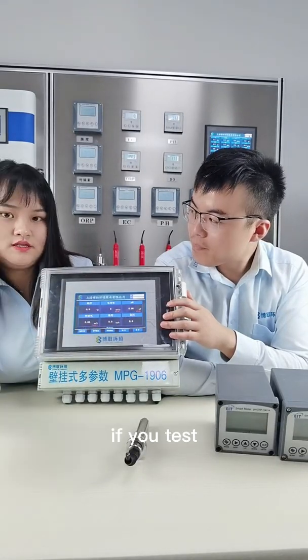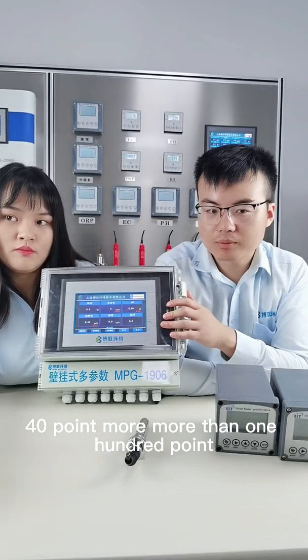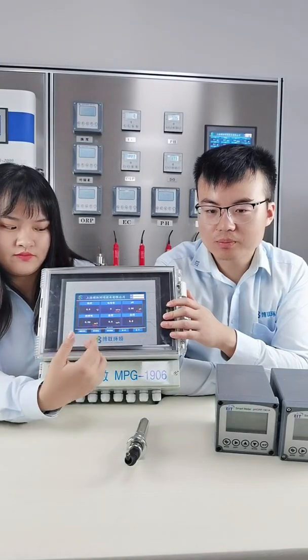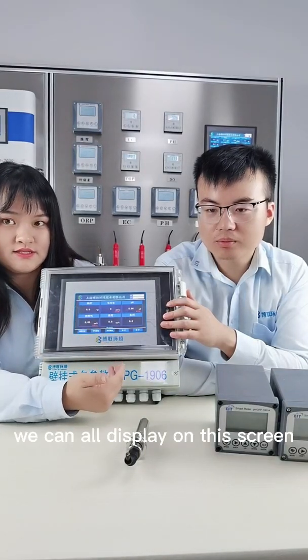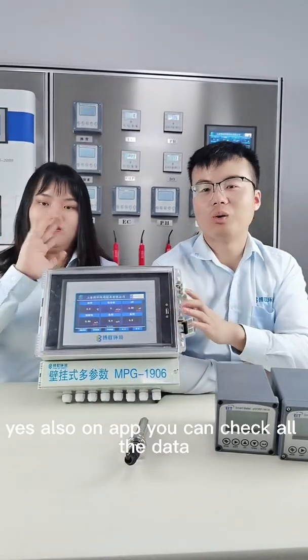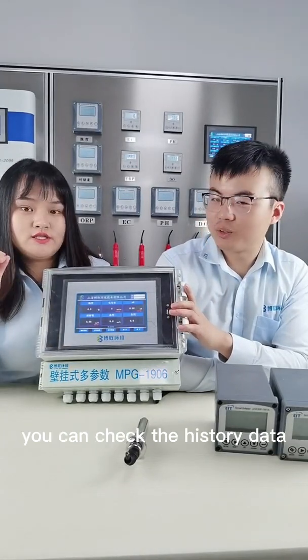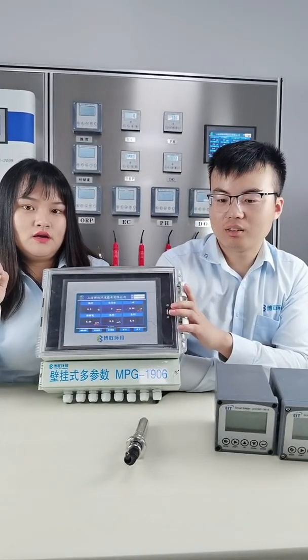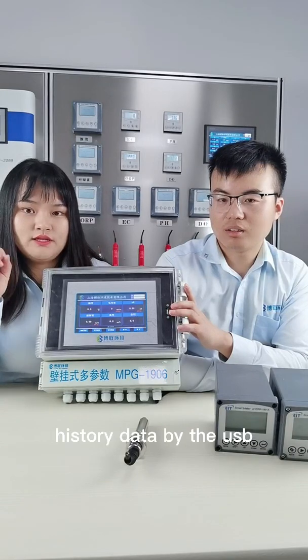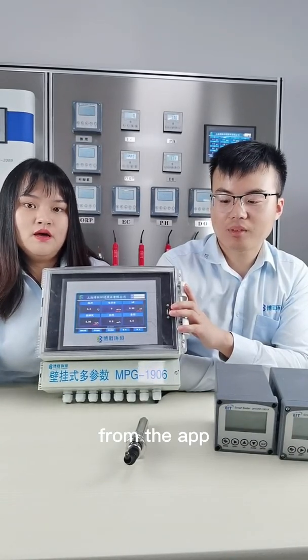From now you can just see one page. But if you test 20 parameters, or you have 20 points, 40 points, or more than 100 points, we can display all of them on this screen. Okay, and also on the app. Yes, also on the app you can check all the data, and it also has the history data. You can check the history data, and you can download the history data by USB or from the website or from the app.